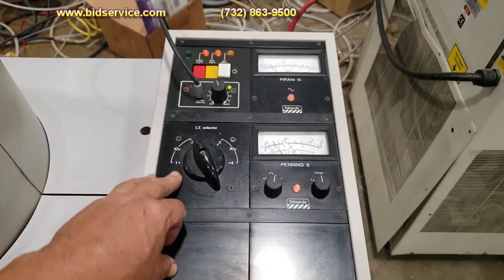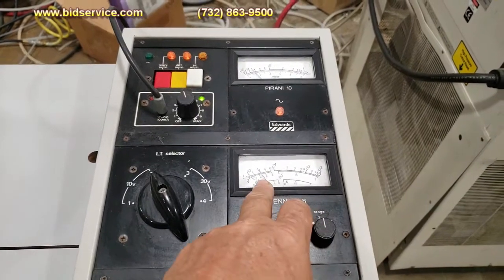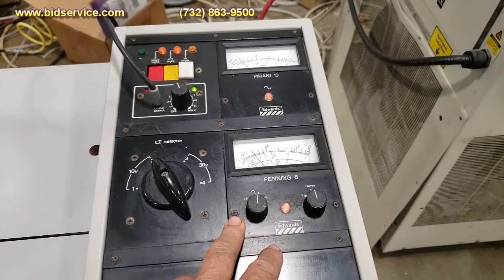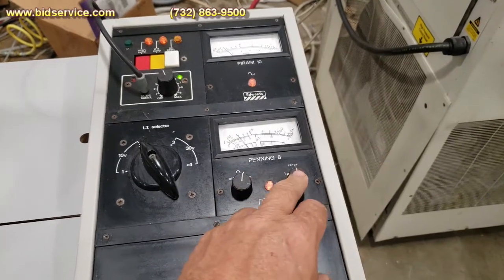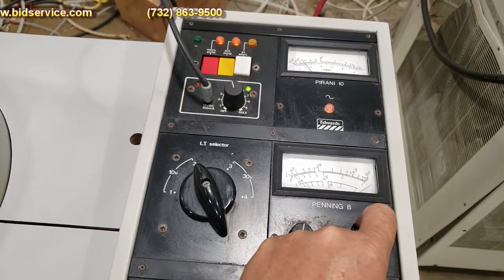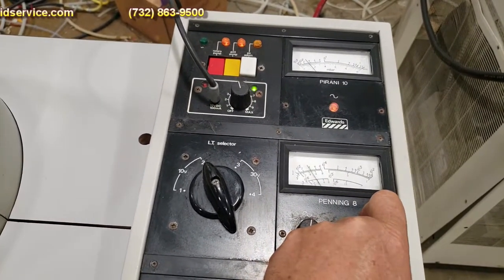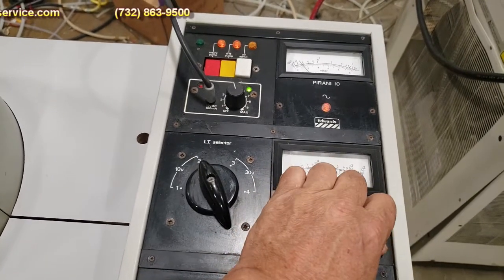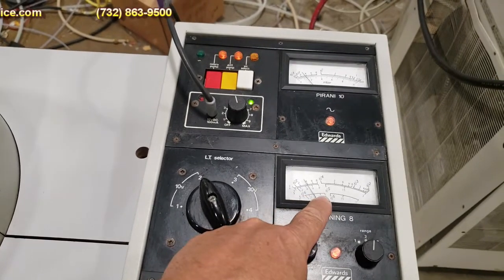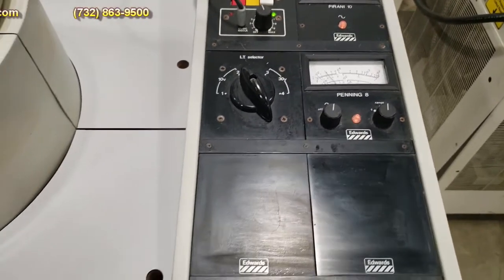I'm in at 10 volts. Over here you have your penning gauge. I'm on the second range, which is reading basically between a five and a six. You have your on and off and then your ranges — you have three ranges, but I am not into the third range as you can see it pegs itself all the way over. On the second range it reads here, and the first range is pretty much buried, so there's a six right here and a five, so you're midway, right above the four.